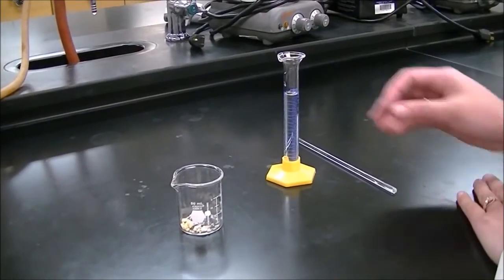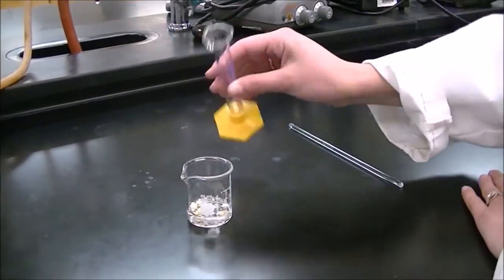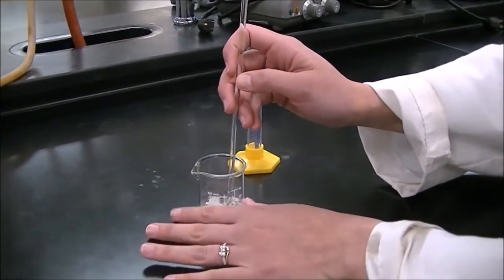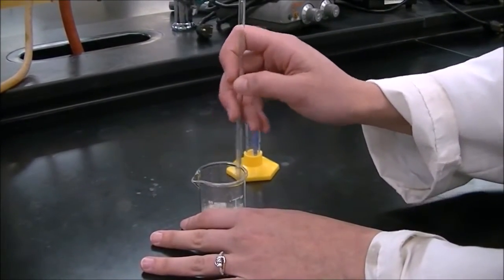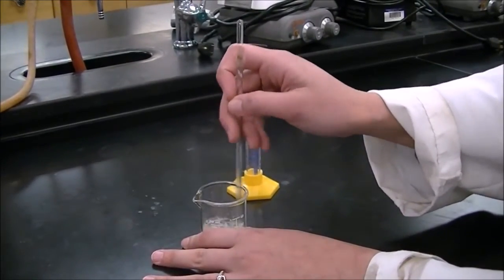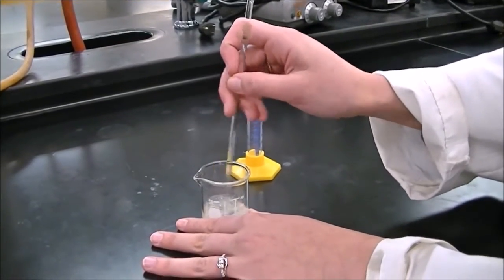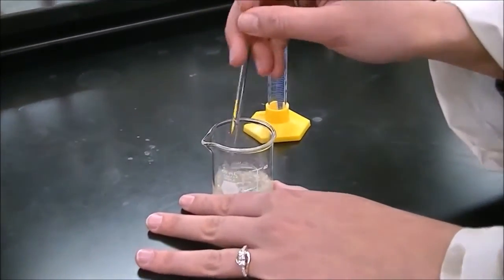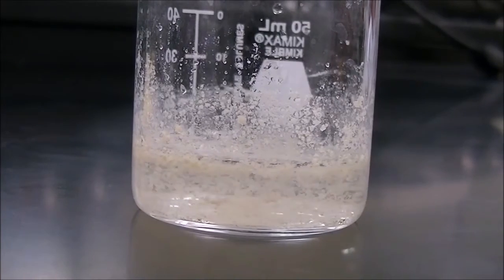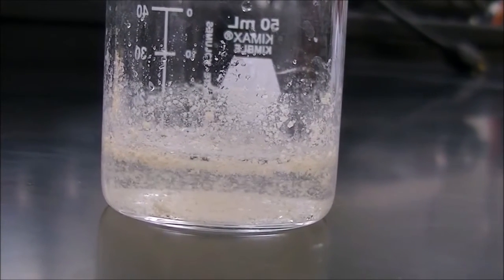Add 10 milliliters of water to your small beaker. Next, stir the product vigorously because you want to dissolve all of the succinimide byproduct in the water. The desired product has a very low solubility in the water and will remain in a solid state. As you can see, while we were stirring, we do end up with product because it looks like we have floaties in our beaker.